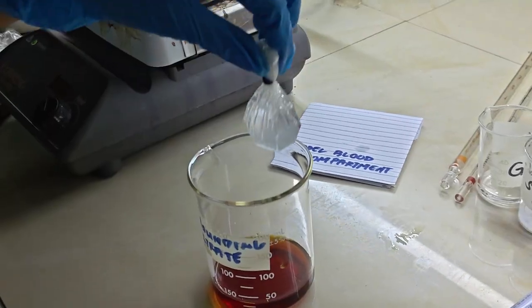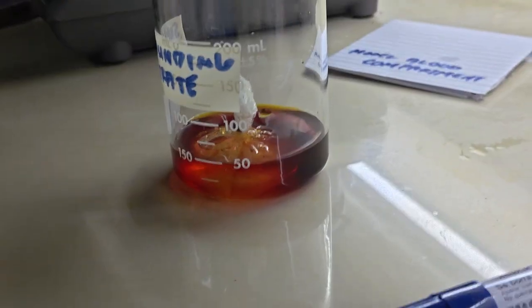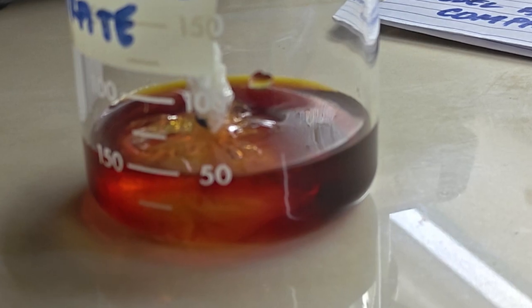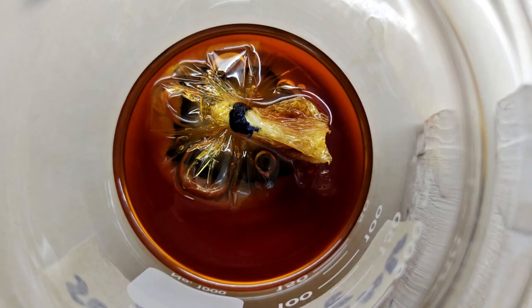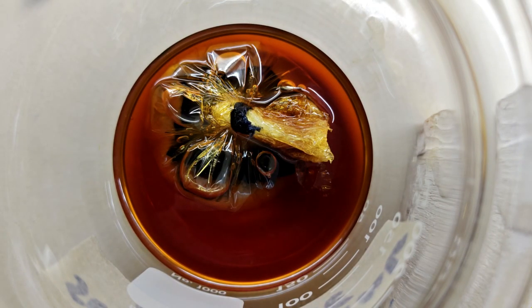Then, the bag is lowered into a beaker of some iodine solution. Here, I tried to make sure the bag was not submerged all the way in case some may seep from the top and skew the results. Over time, the starch molecules in the bag turned dark. This is due to the formation of a charge transfer complex, absorbing a different wavelength of light and causing the dark color. This reaction indicates that polyiodide ions crossed the semi-permeable barrier and created a complex with the starch molecules.